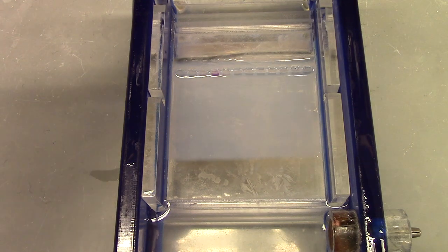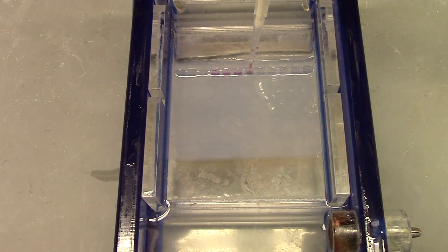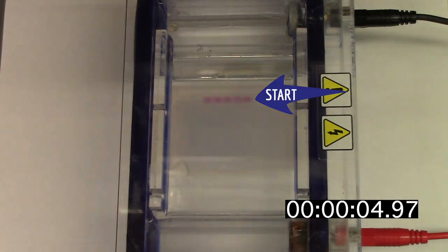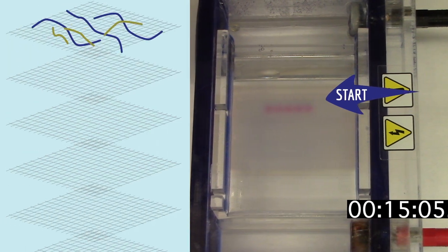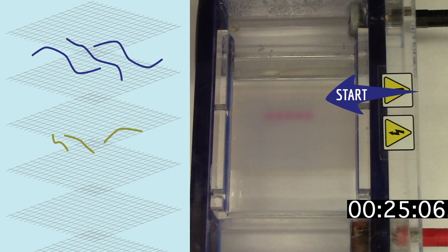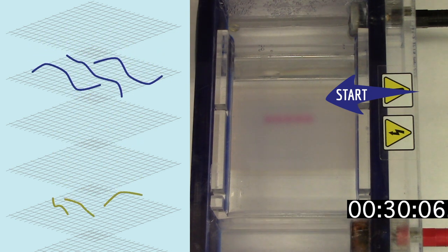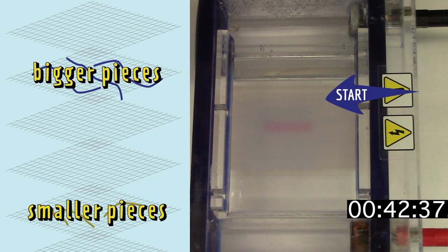Here I am loading the DNA into the gel. I've added loading dye to the DNA samples, which lets me see the liquid as I pipette it into the gel. Once I've loaded all my DNA samples, I turn on the current, which pulls the DNA through the gel. Remember that the DNA molecules are moving through a molecular mesh. The smaller pieces of DNA snake through the holes of the mesh easier than the bigger pieces, so the bigger pieces end up higher in the gel than the smaller pieces.